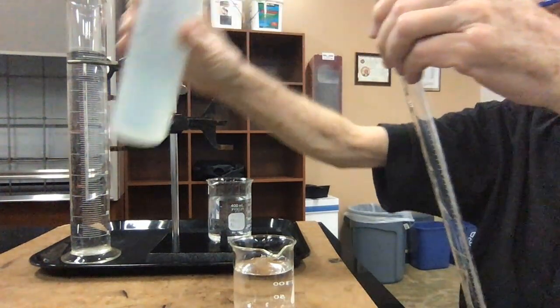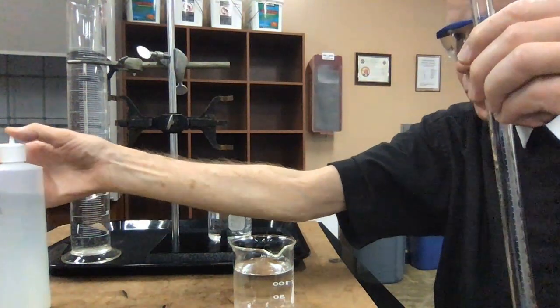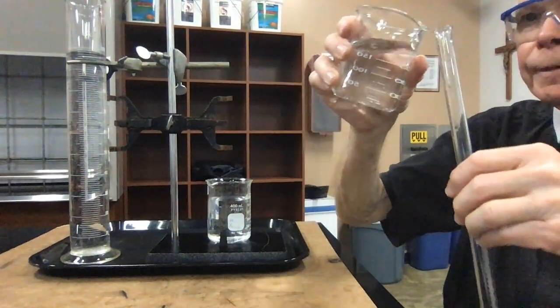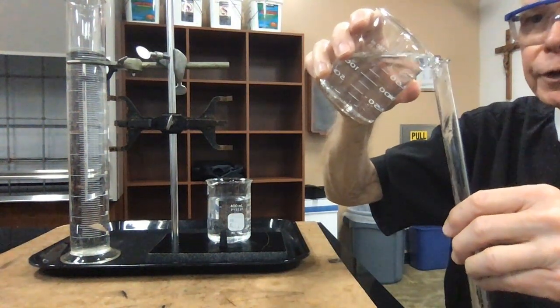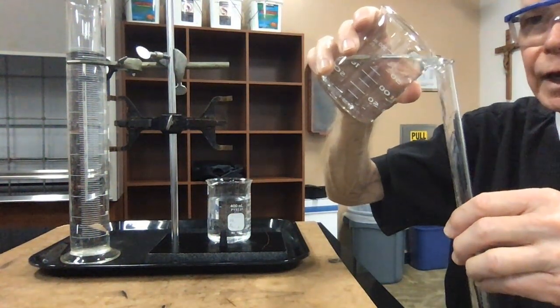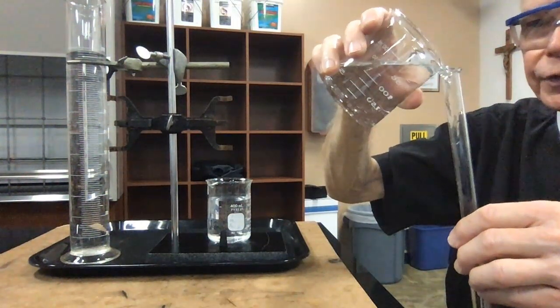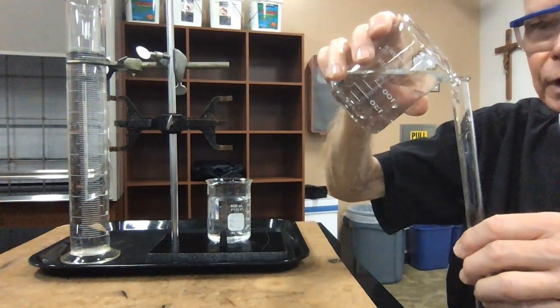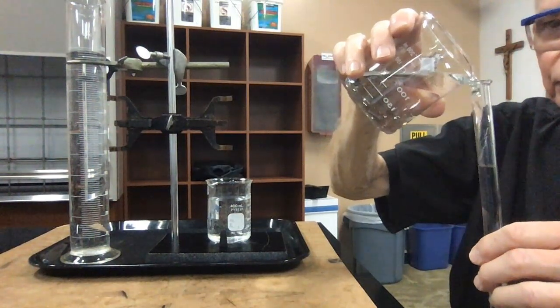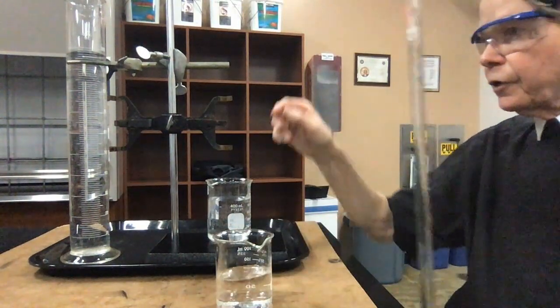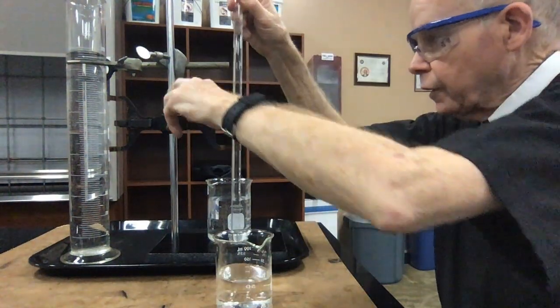Okay, so there's our acid. It's pretty strong, so I'll be careful with that. And then let's put water in, and my water sits on top of the acid. The acid is a little bit more dense, so as I add the water here, the water will just accumulate on the top of the acid. I'll fill it all the way to the top, and let me momentarily clamp it into the burette clamp, and that'll hold it for the time being.